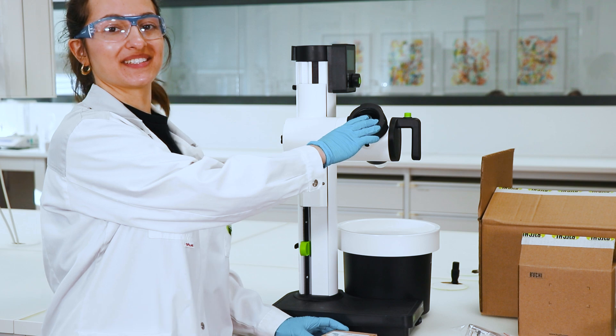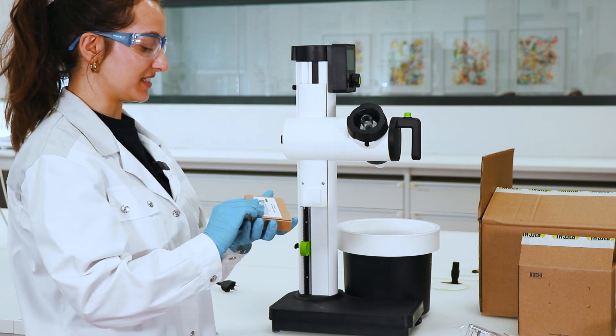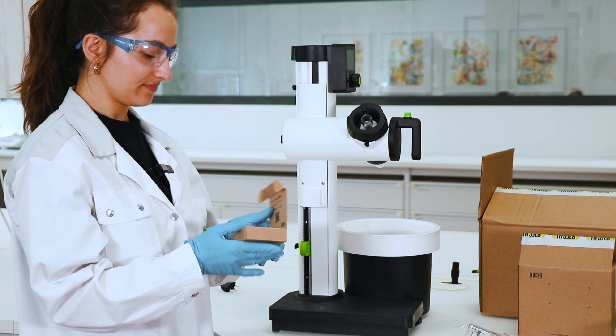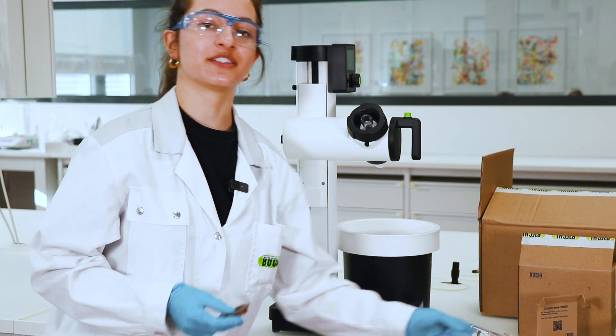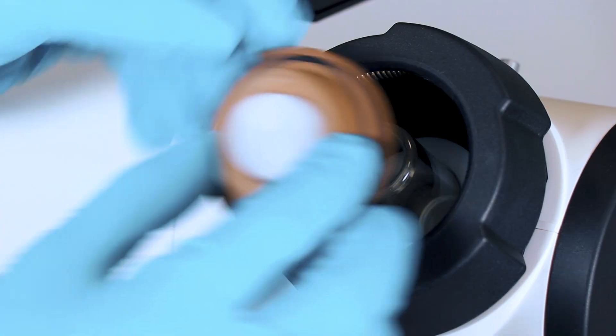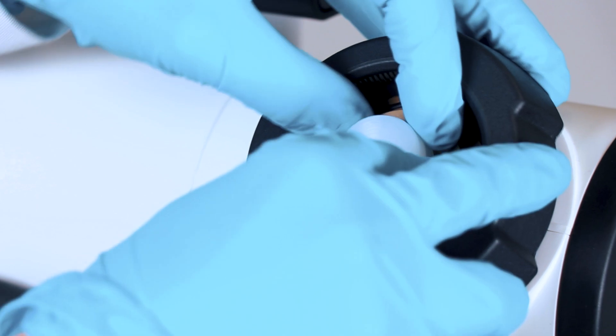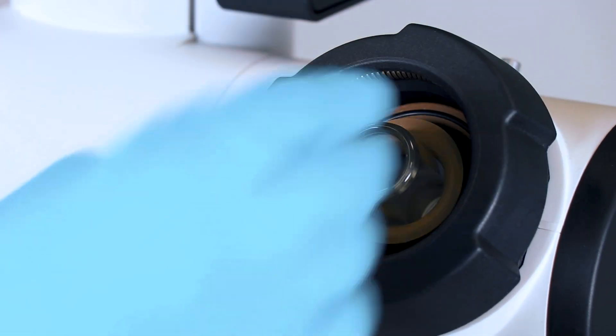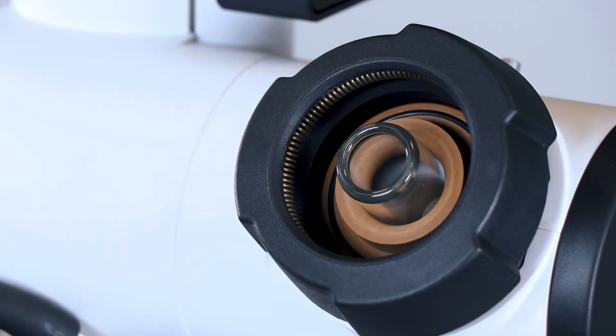Okay, so now that the vapor duct is installed, you can install the seal. You just take the seal with the adapter, apply even pressure and take off the adapter.